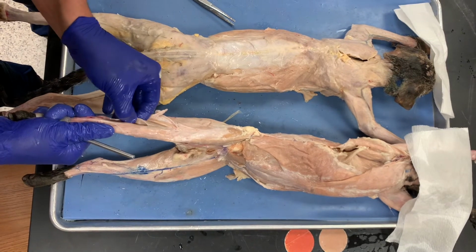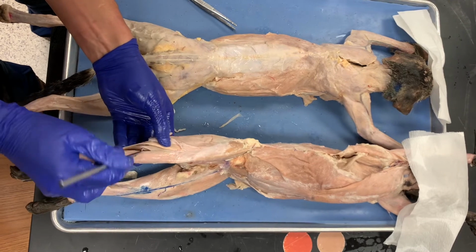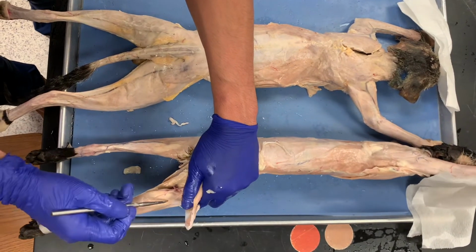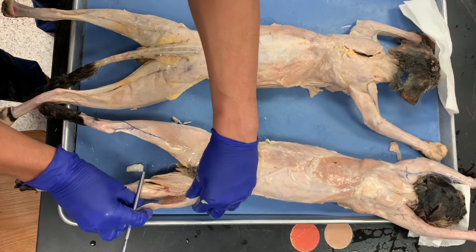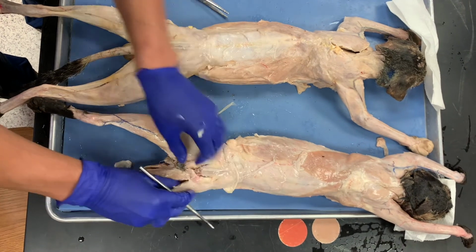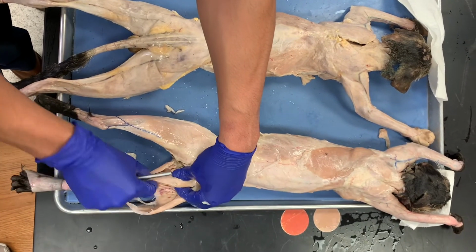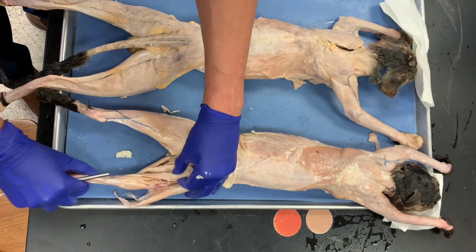And then if you look at it laterally, this muscle that's deep here is the soleus. So the soleus is there, and then this is the gastrocnemius. Here I can turn him over, and then you can see the medial and the lateral head of the gastrocnemius. So this is the lateral hamstring. This would be the biceps femoris, and then the semi group would be here, the medial hamstrings right there. They're all going downwards here. So yeah, those are the medial hamstrings.